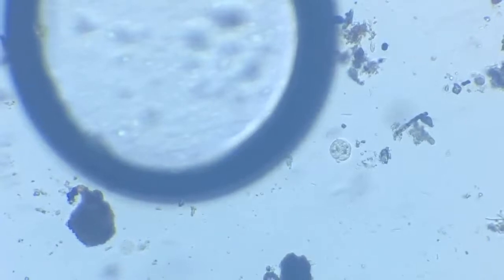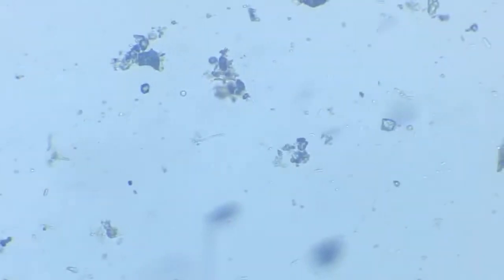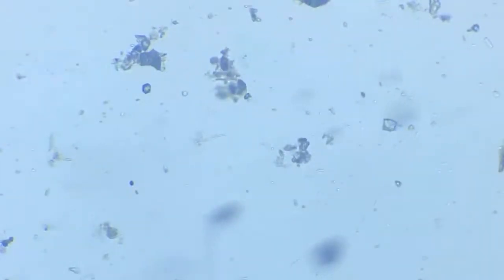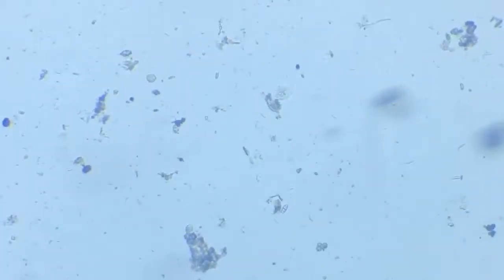All right, so now let's start moving the slide. I was trying to find an amoeba here. Let me work on that. There was one, at least one that I had noticed. Must not have gone far, but you never know. Give them a few seconds, take your eyes off, and they just wander somewhere. All right, here it is. I found it.